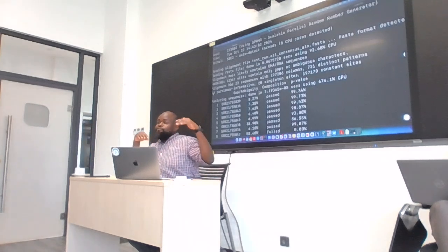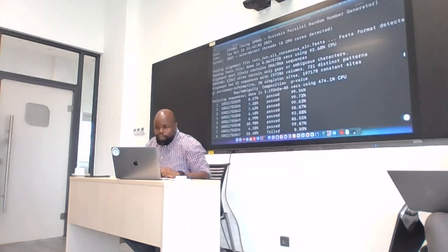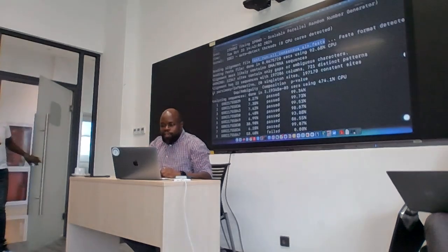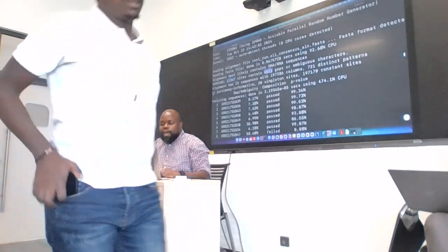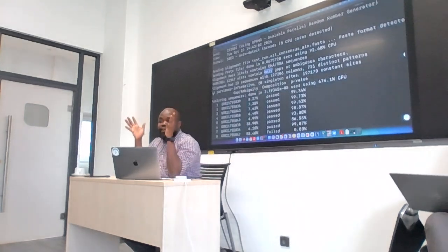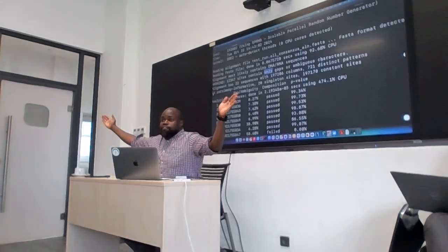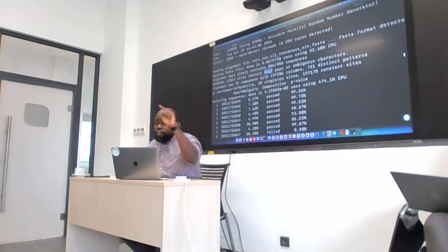The reason I like looking at this information is because it tells you a bit more about your alignment, okay? So up here, it's telling you the file that it read in, just to be sure that what you intended is what was read. And then it's saying, warning, 12,000 sites contain only gaps or ambiguous characters. So from the alignment, there are 12,000 sites that contain either only gaps or ambiguous characters. Remember that there were large stretches of positions in our alignment that had lots of Ns. Okay? Yes. So that's what it's saying.